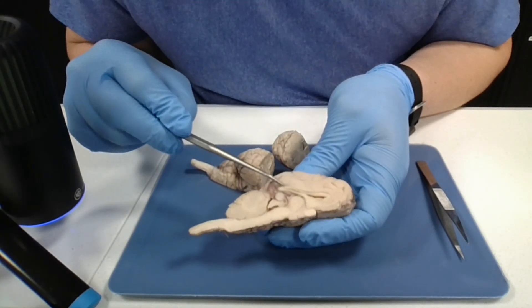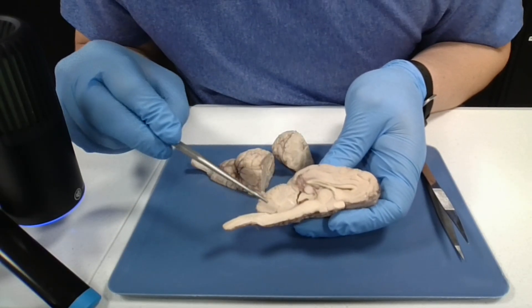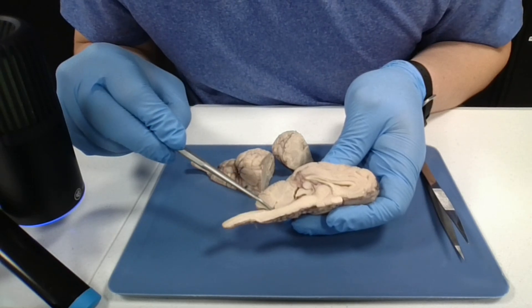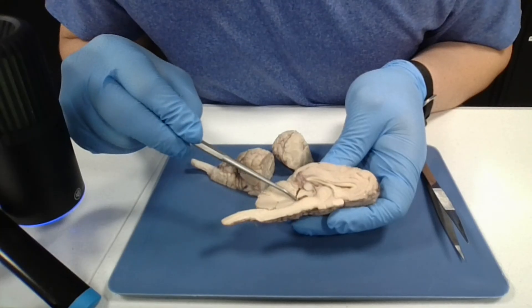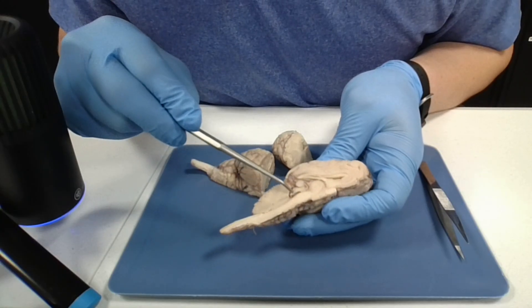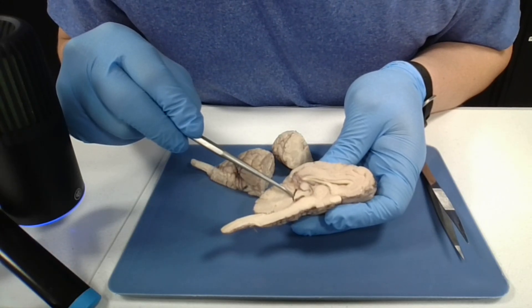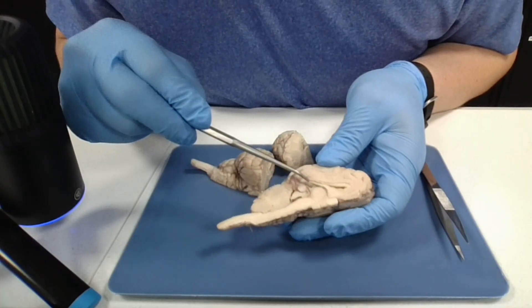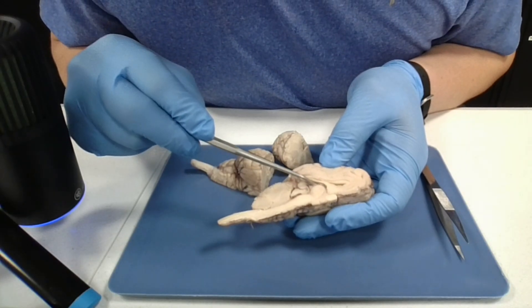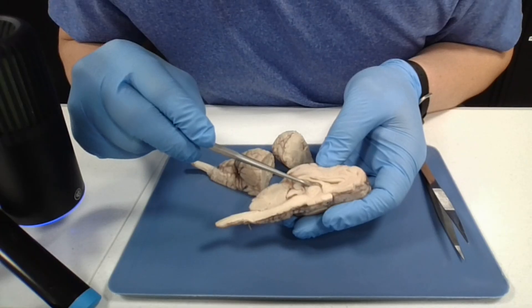There are four fluid-filled ventricles inside the brain. We can't see ventricles one and two very well with this cut, but we have four here. This is the fourth ventricle — this open space — and that leads to the cerebral aqueduct here, which is this space here. The third ventricle is right above the thalamus. If you look really closely here, you can see the choroid plexus, which has little capillaries that produce the CSF, or cerebrospinal fluid.